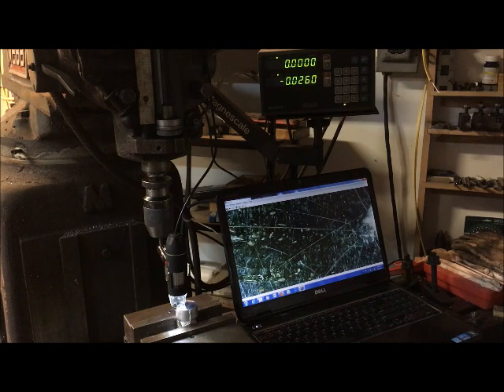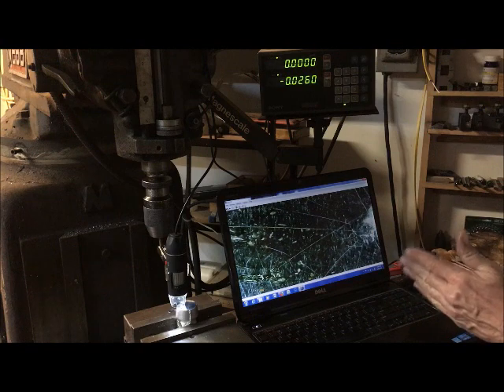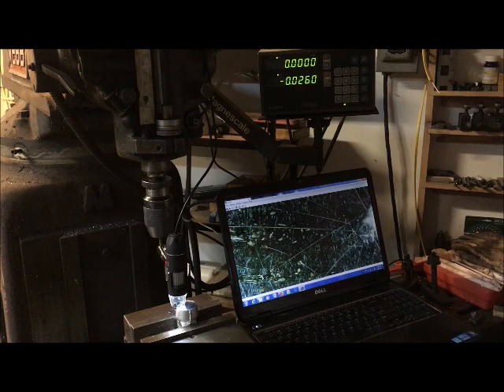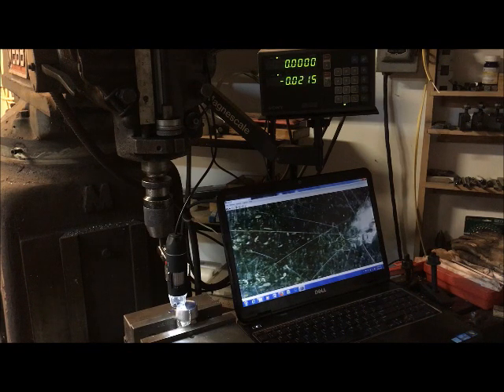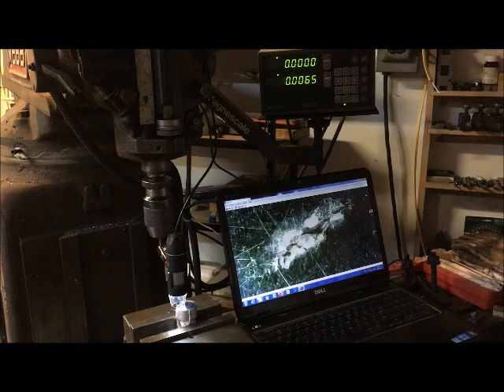So that's a big defect. It's 24 thousandths by 26 thousandths. It doesn't look square on the screen because the aspect ratio of the microscope's not unity. So if you don't know how big something is, you have to scroll across it to determine. So this is 24 top to bottom and 26 left to right.